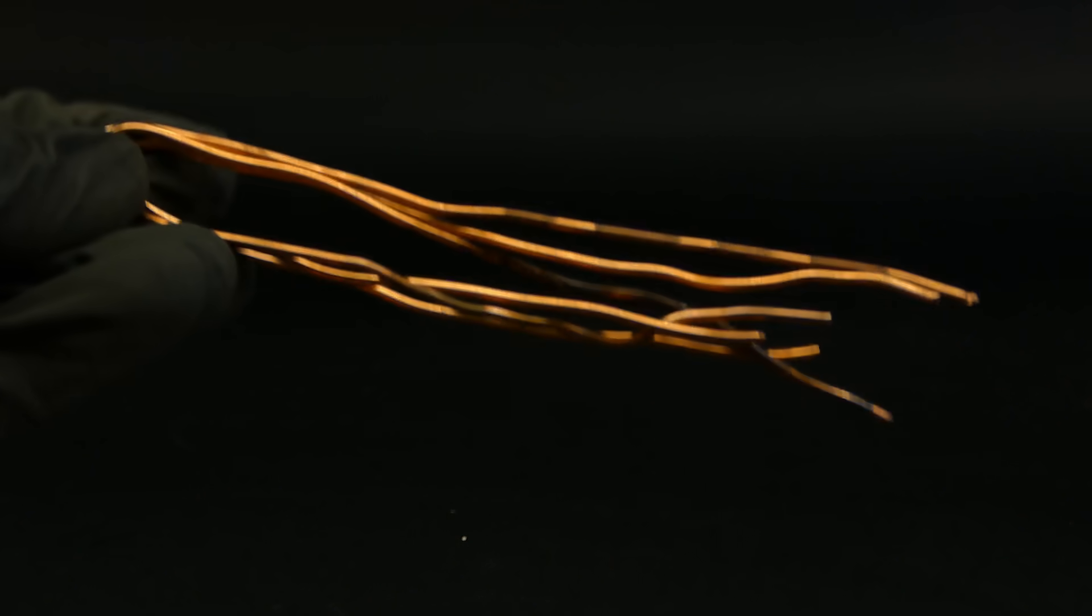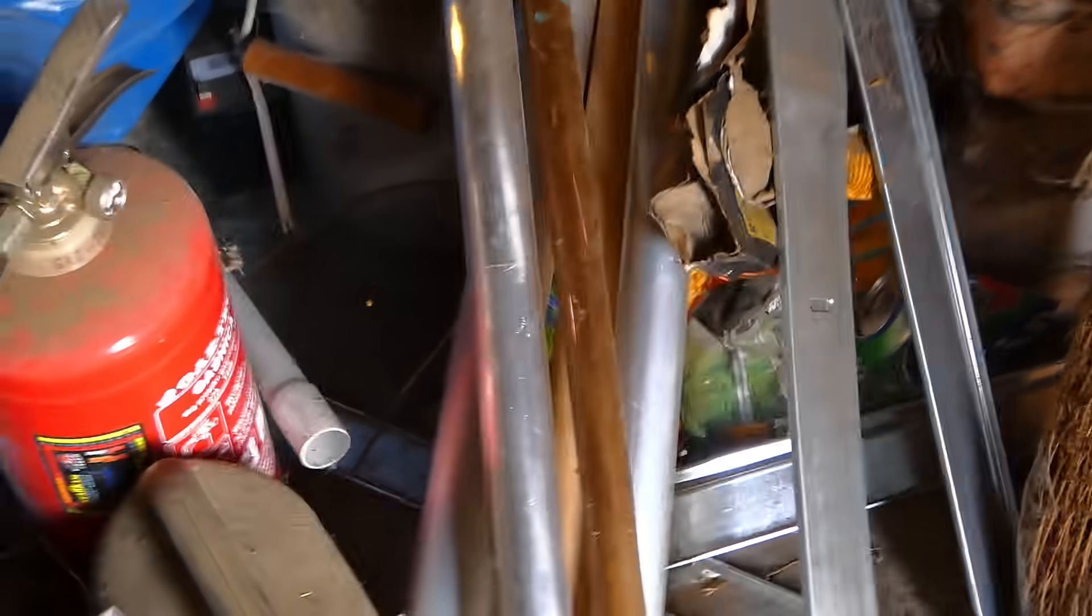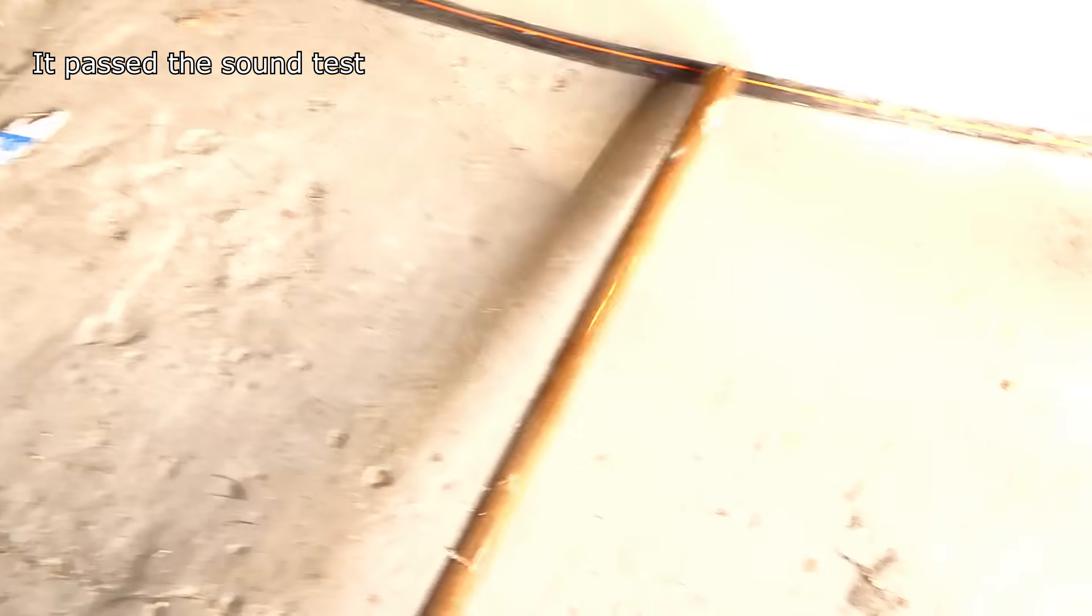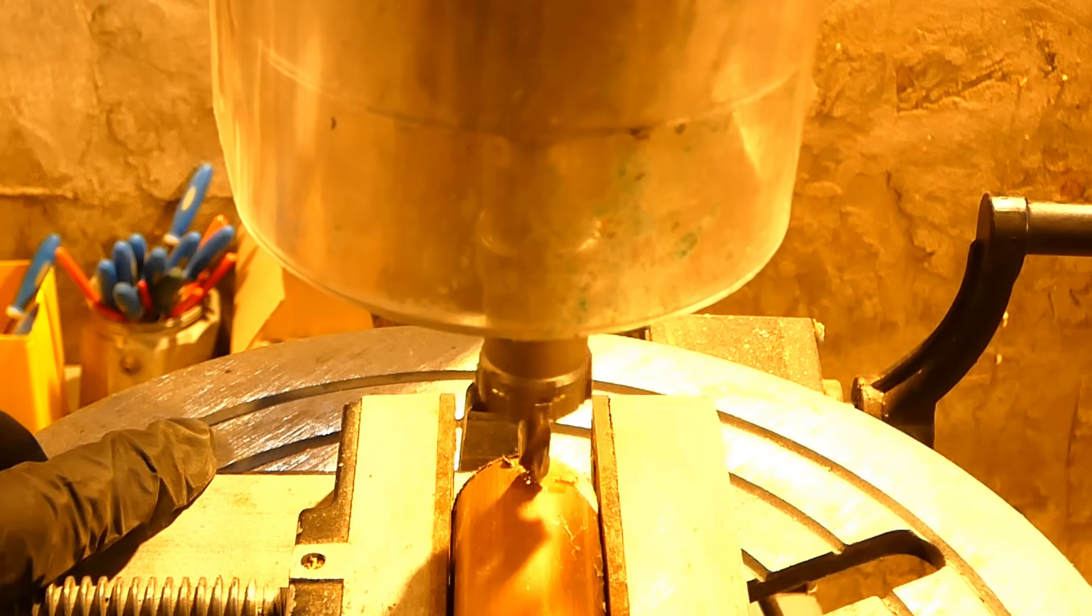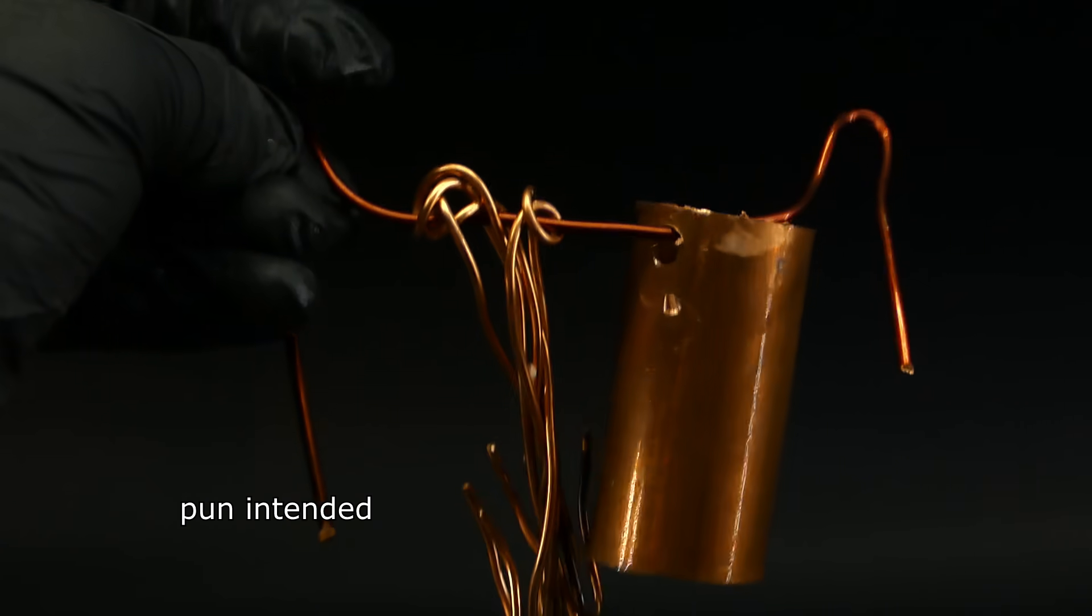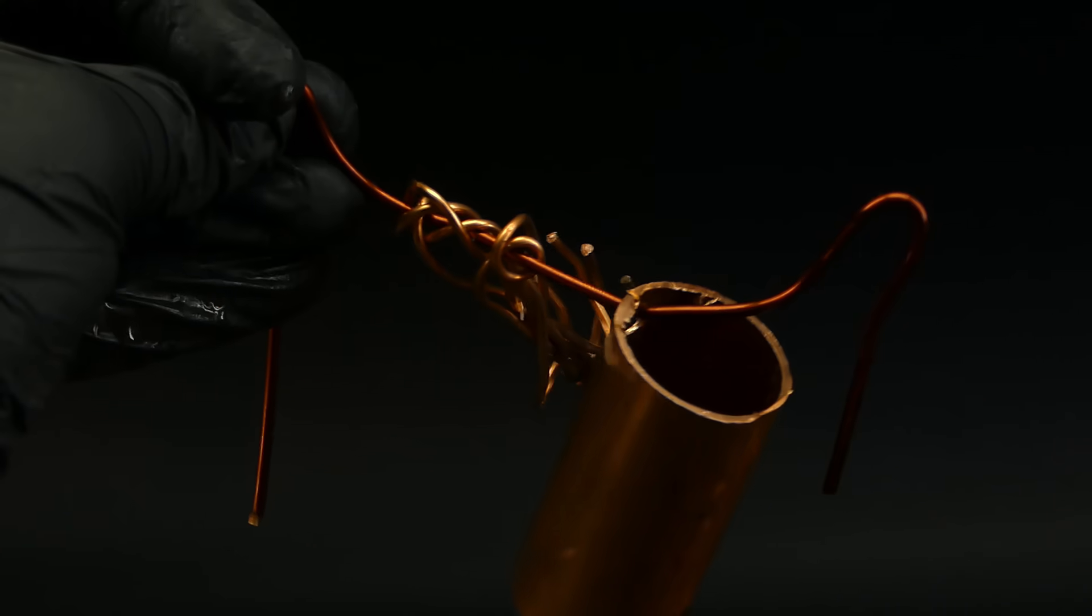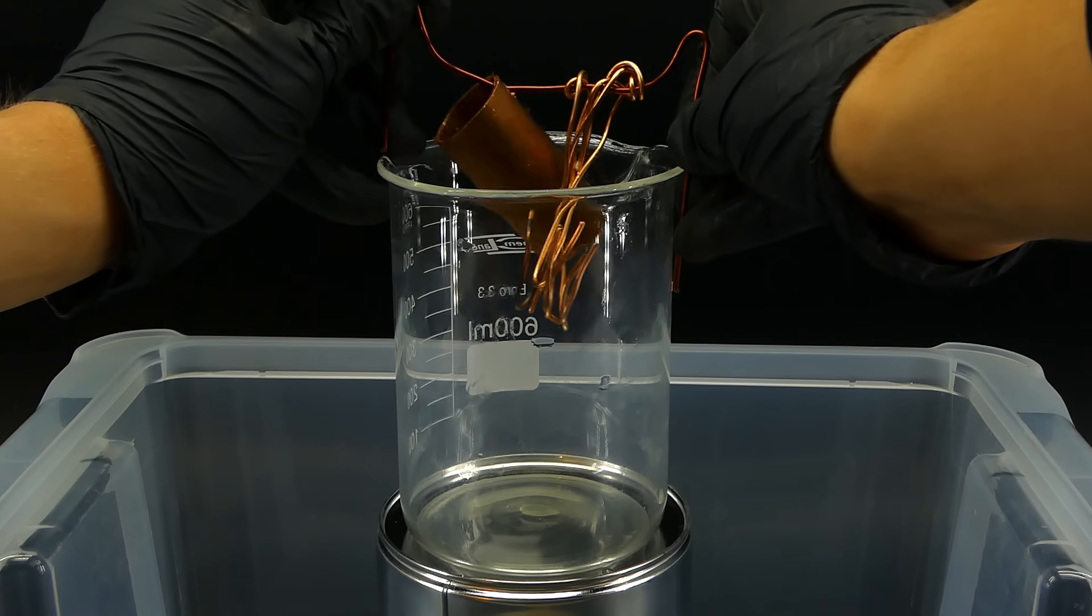Copper should work much better, but I felt like the three pieces of cable just wouldn't be enough, so I searched some more and found this old copper pipe. It looked alright, so I cut out a piece of it, drilled a small hole through it, and assembled this really amateur-looking contraption, which holds the copper in place and seals really well onto a beaker.